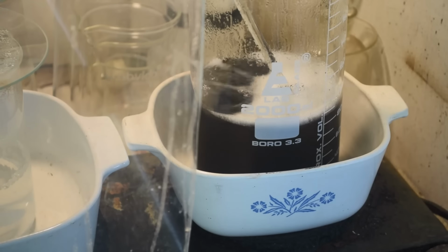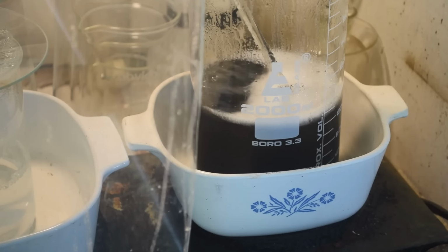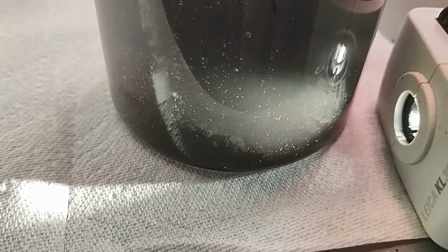We'll pull this out. We'll have a look at it and see if I want to leave it or try to boil it some more. Maybe even add some more ammonium formate to it. I might just have to go to the store and get some more ammonia to do the second half of this stuff. We'll see. Okay, so here we go.